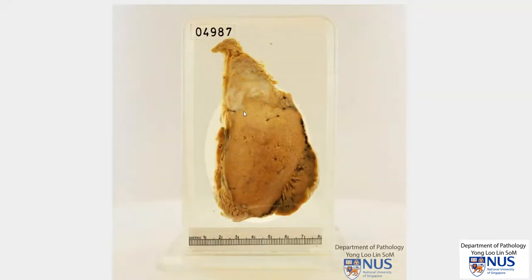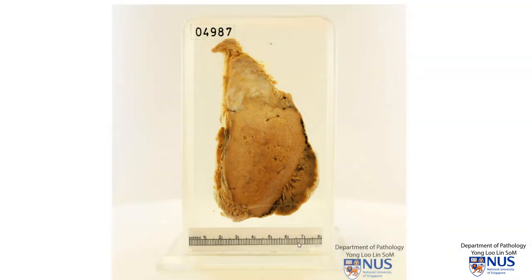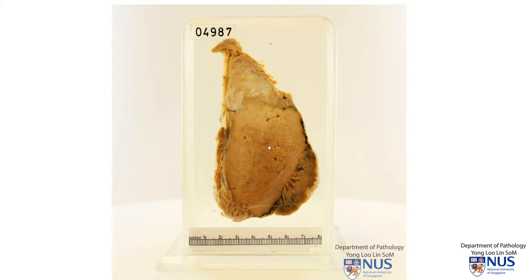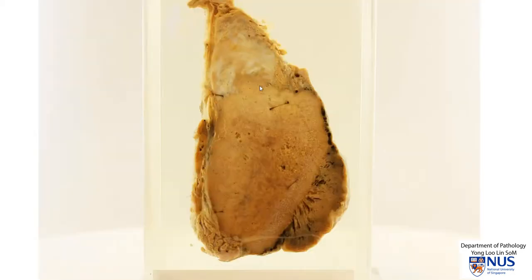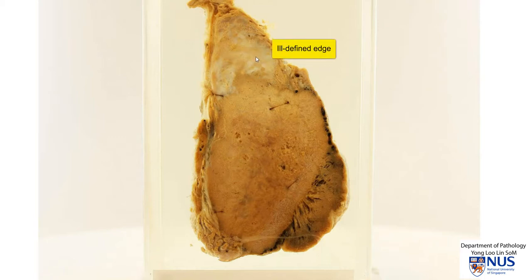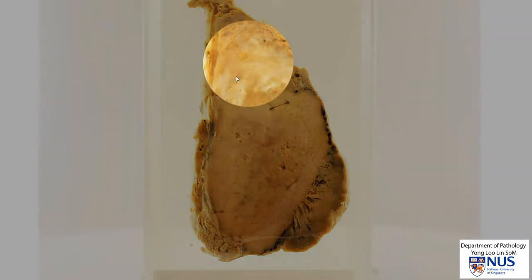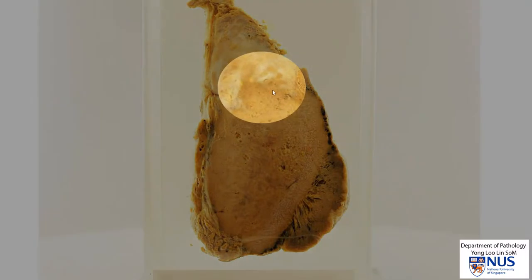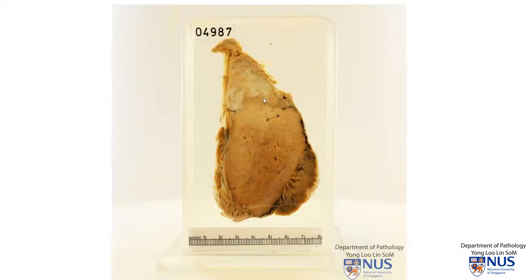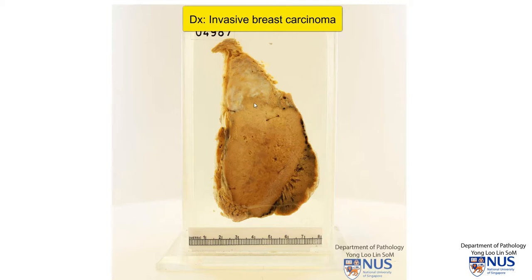We're looking at a very large tumor mass within the breast and if we compare this with the scale, it is probably close to about 6.5 centimeters in maximal dimension. It is fleshy. And when we look at the edge of the mass, it is actually quite ill-defined. These whiter and yellowish areas are normal breast parenchyma with some fibrous stroma and adipose stroma, whereas this tan area is the tumor. We can see that it is infiltrating into the breast parenchyma. So we are dealing here with an invasive breast carcinoma — it is clearly mass forming and it is infiltrative.